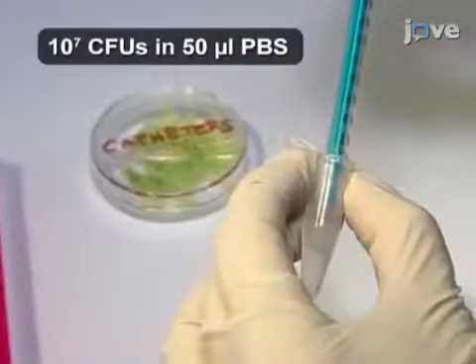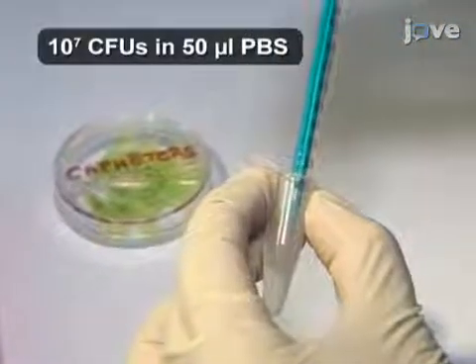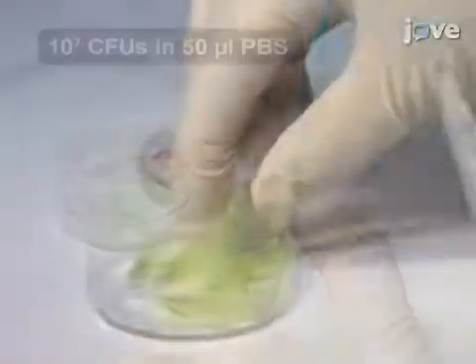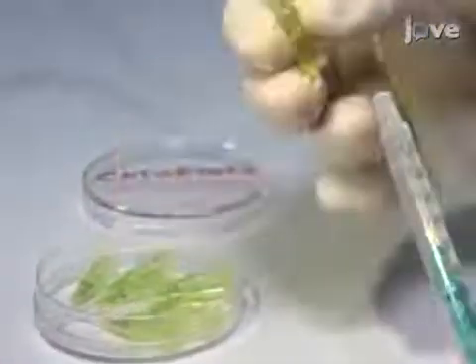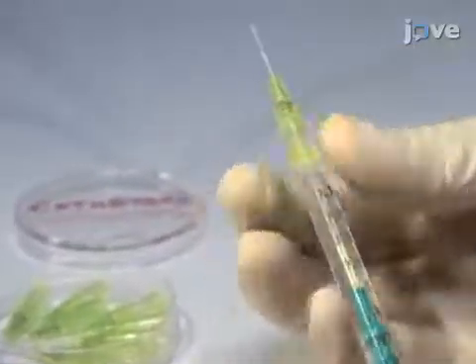Draw the bacterial inoculum into a 1 milliliter syringe and attach the catheter to the end of the syringe. Tap the syringe to remove any air and depress the plunger.